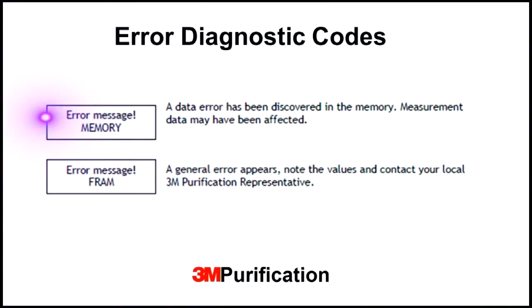This message is an indication that a data error is present. Contact 3M Purification technical support. This message is indicative of a general error that may appear. Note any values displayed and contact 3M Purification technical support.